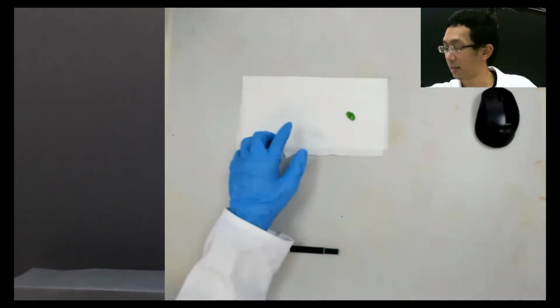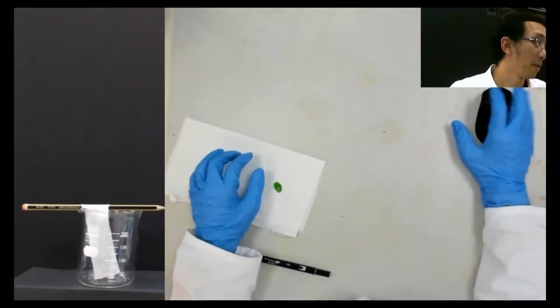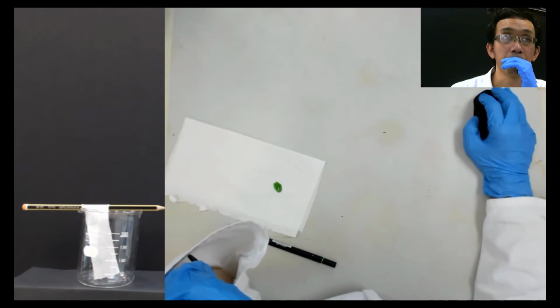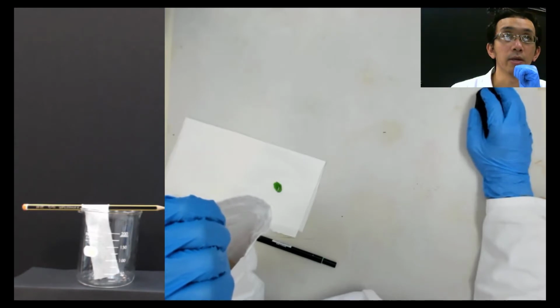So for example, let's say I have prepared this here. Okay, you cannot see, I put it here. Let me zoom a little bit because maybe it's quite far. Where is the zoom? Okay, wait.